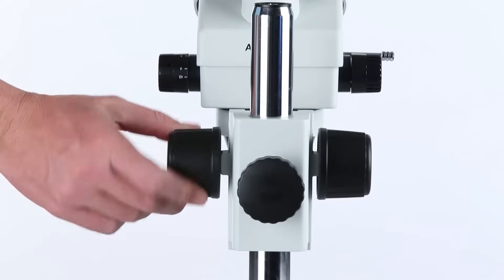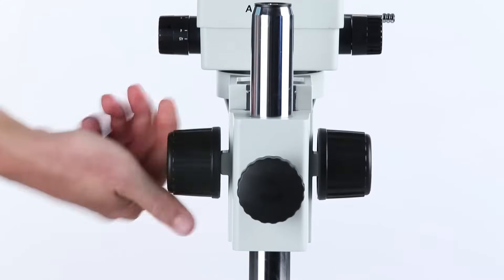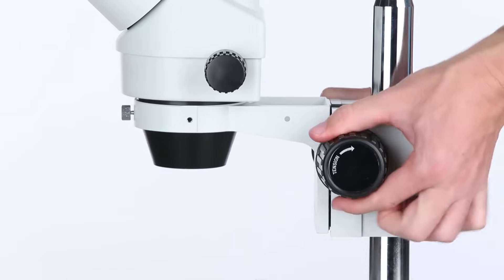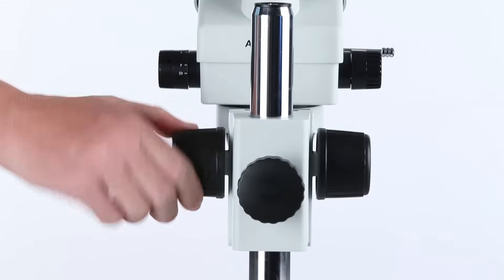Be careful not to decrease the tension too much or the focusing rack will creep. Be sure that the tension is high enough to support the head and any accessories you've added.